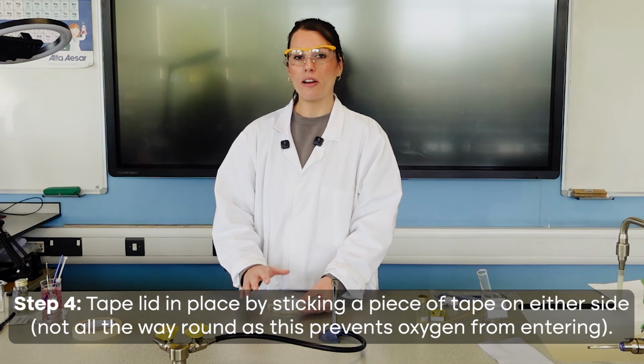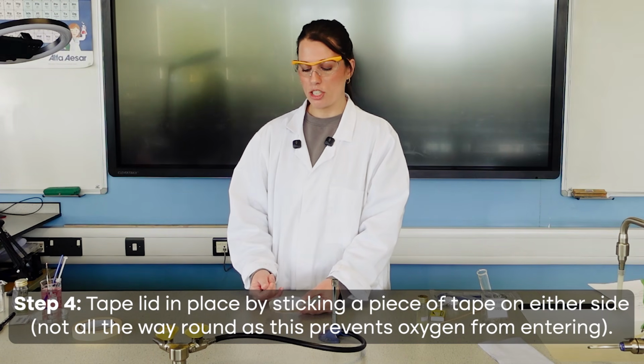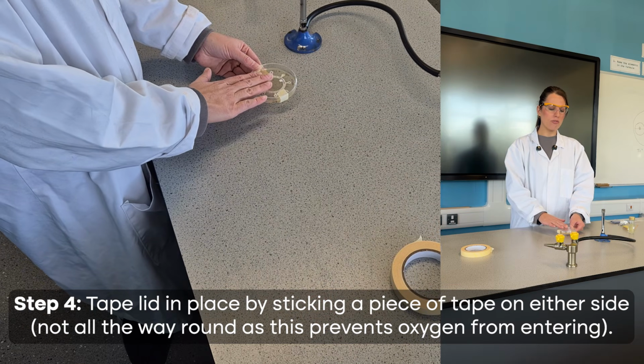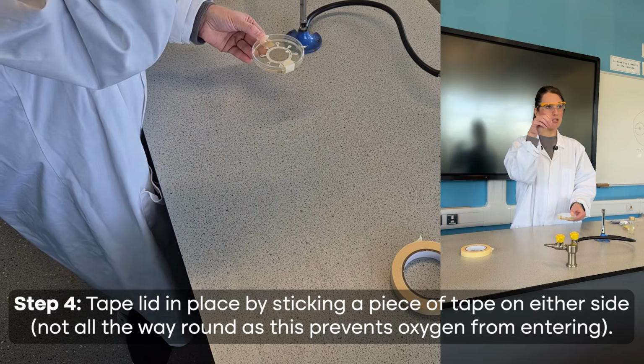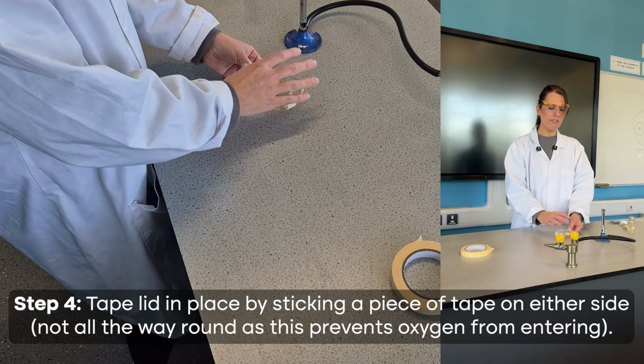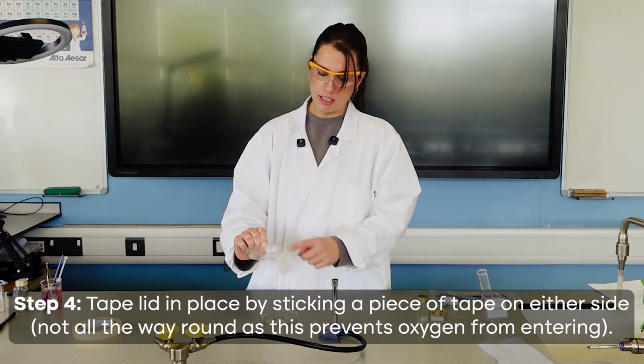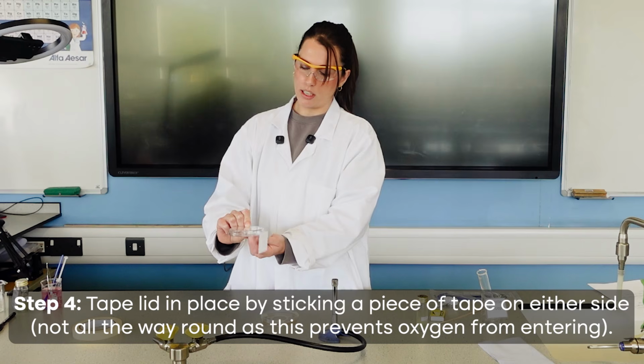there, they're going to respire, and water, in the form of water vapor, is one of the products of aerobic respiration. And that water vapor is then going to rise to the lid, condense, and it can drip back down onto the dish. And if you then have pools of water, that can affect the inhibition zones. So instead, we flip our dish upside down so any condensation lands on the lid.